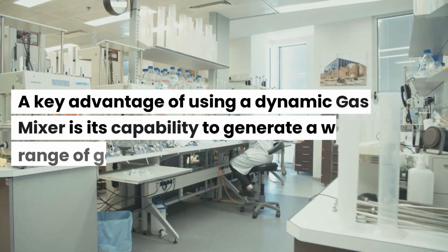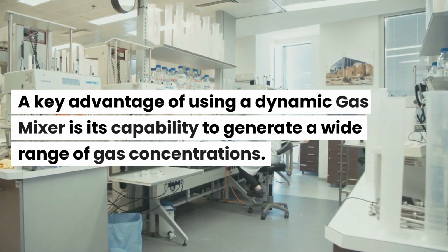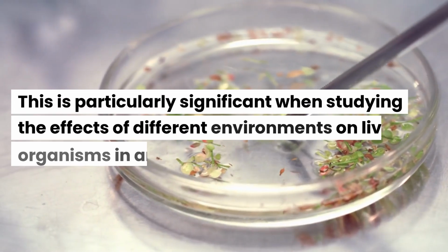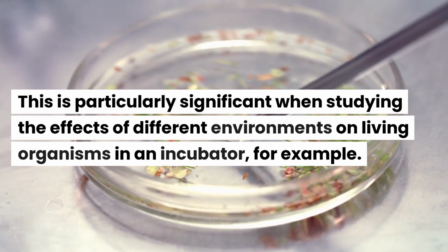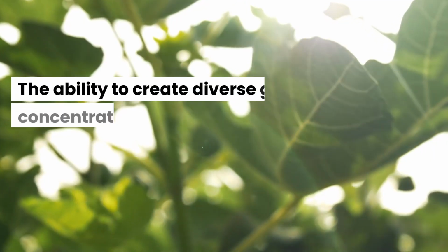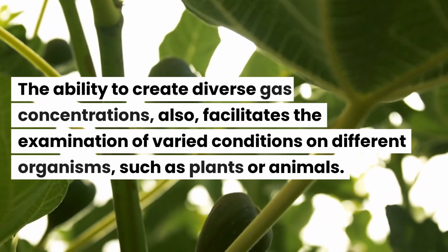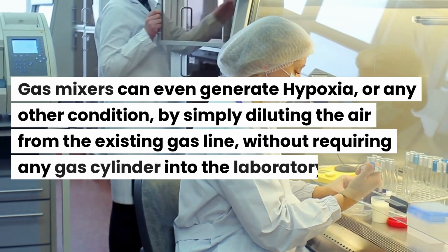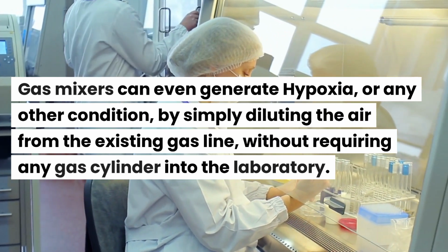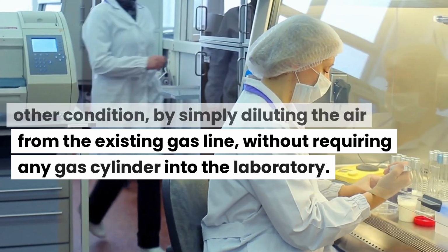A key advantage of using a dynamic gas mixer is its capability to generate a wide range of gas concentrations. This is particularly significant when studying the effects of different environments on living organisms in an incubator, for example. The ability to create diverse gas concentrations also facilitates the examination of varied conditions on different organisms, such as plants or animals. Gas mixers can even generate hypoxia, or any other condition, by simply diluting the air from the existing gas line, without requiring any gas cylinder in the laboratory.